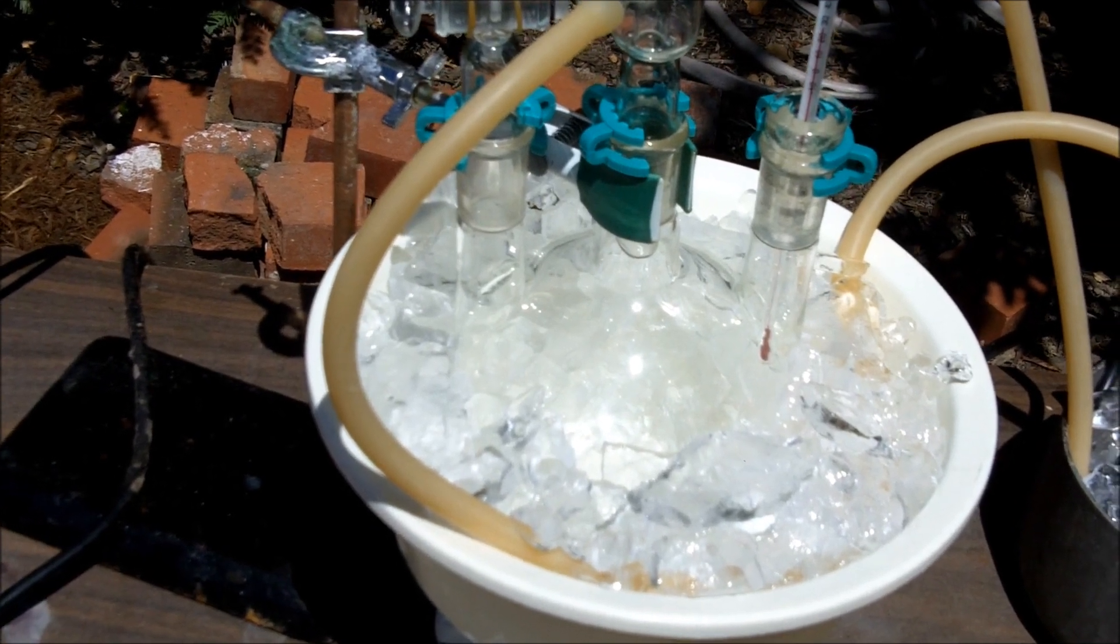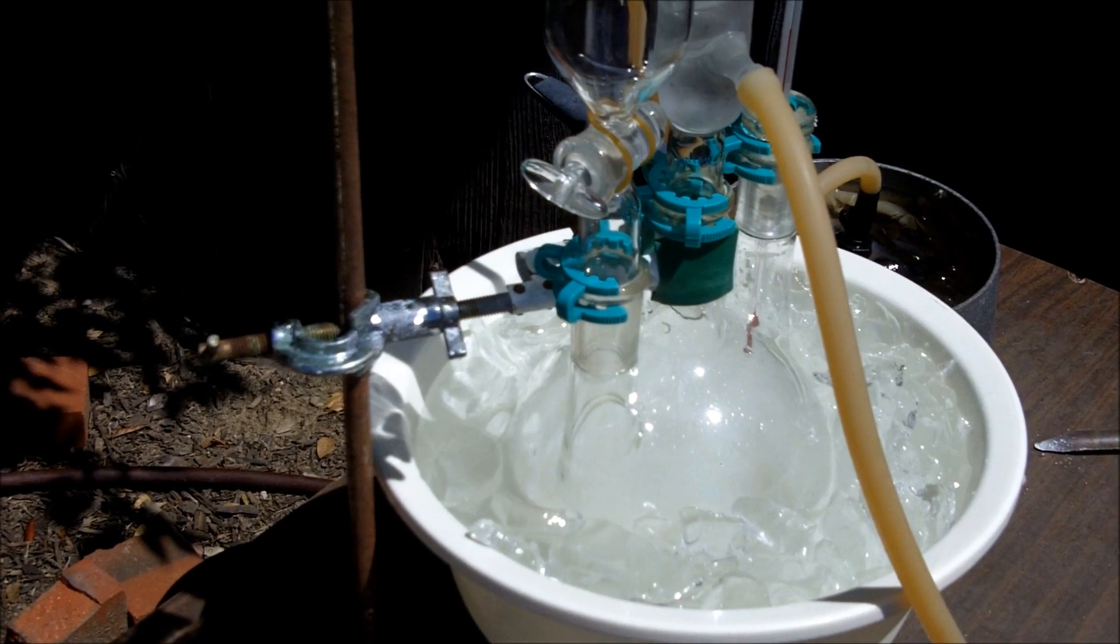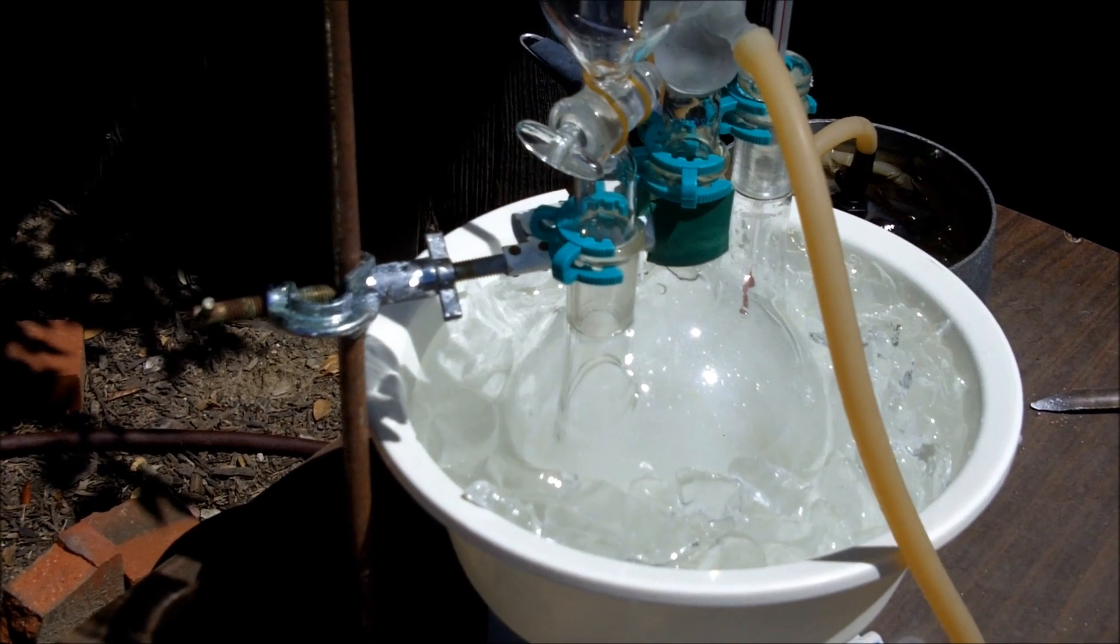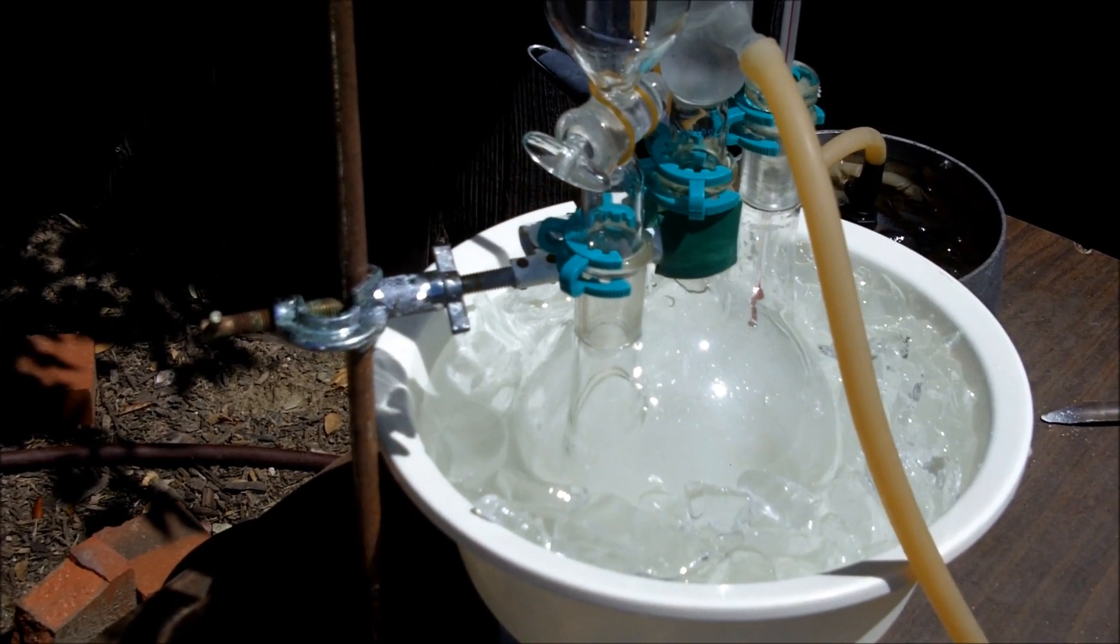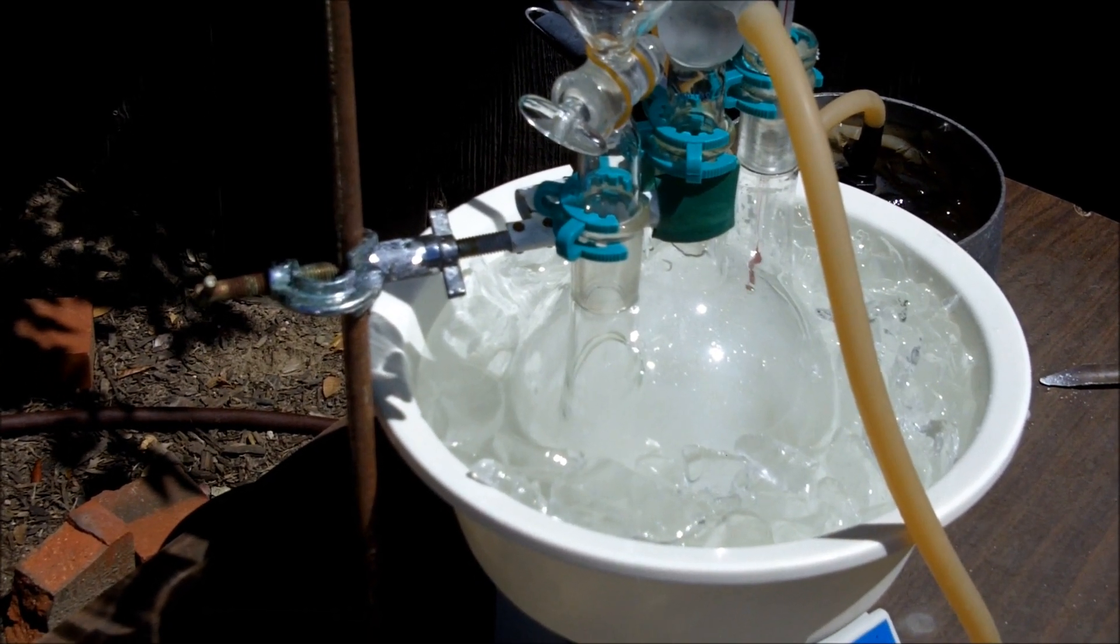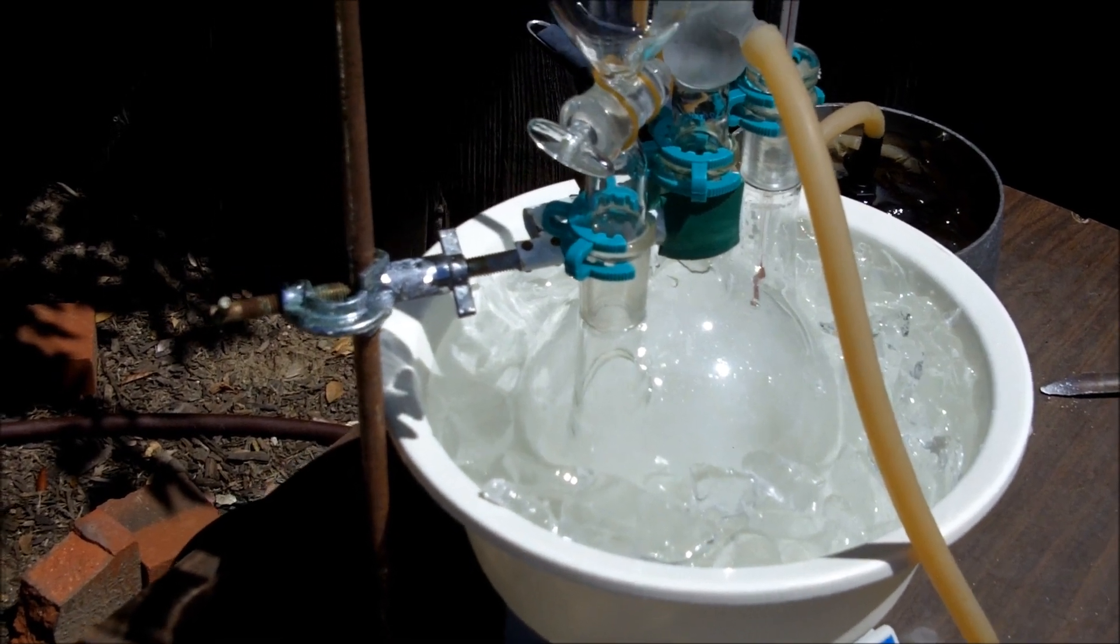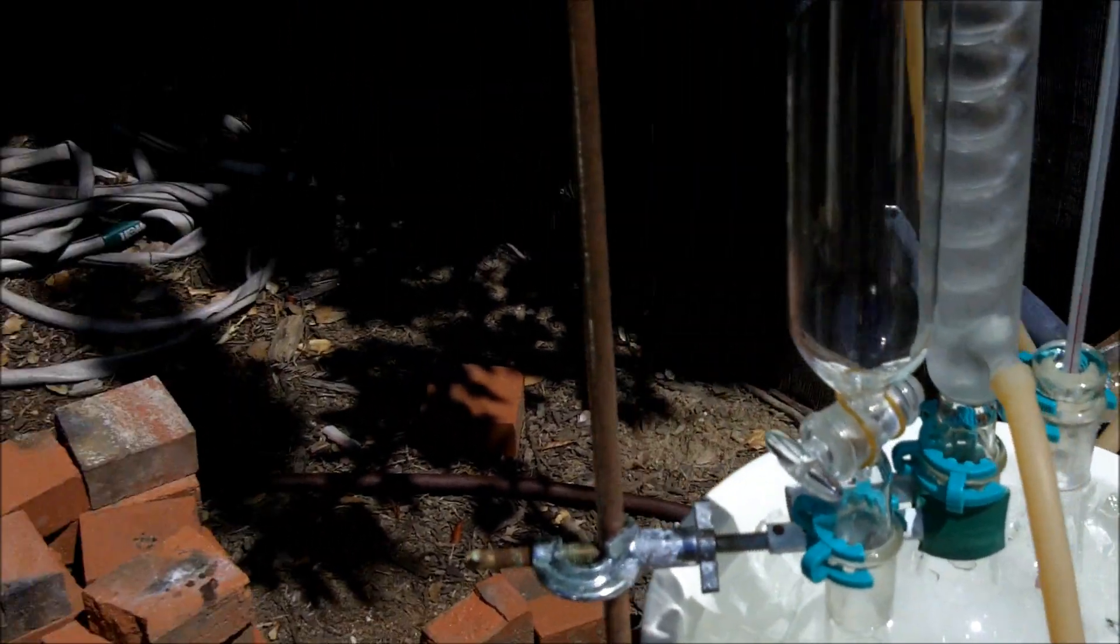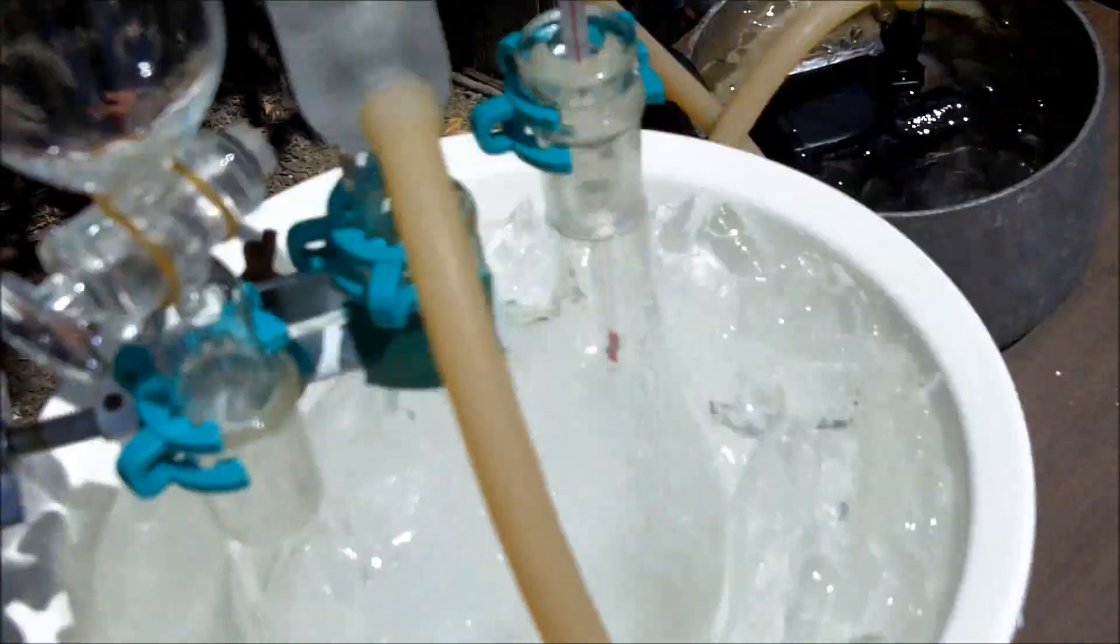Okay, I've added my chemicals. I put in 200 milliliters of water into that round bottom flask and then just kept scooping in calcium hypochlorite till I felt it was good. I must have added a little over a hundred grams by the time I was done.